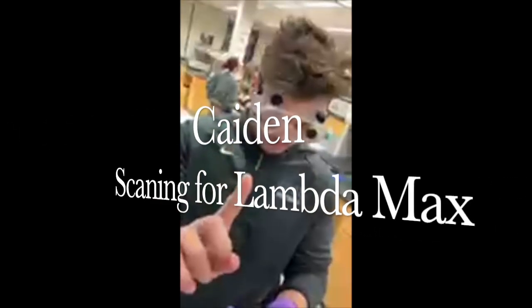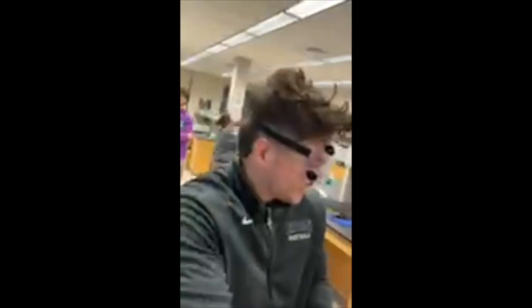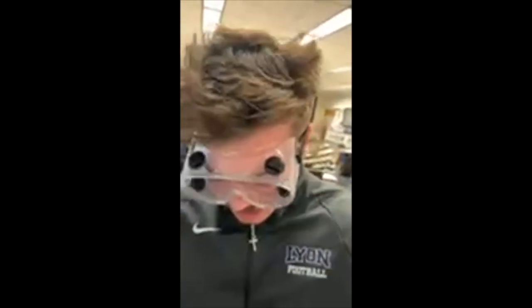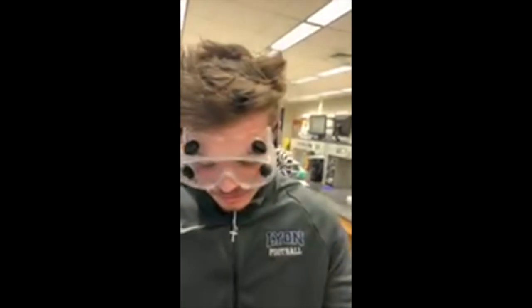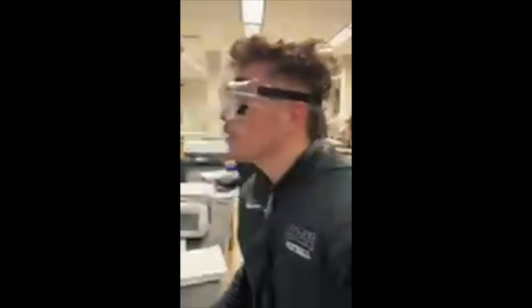Here the graph shows our lambda max is sitting around 640. While Caden regroups, now is a great time to mention, as you will see next, we record the absorbance values in our notebook, ensuring all samples are labeled and significant figures are correct. Lastly, cleanup. After recording data, we carefully remove the cuvettes, as you've seen, and clean our workspace. And now, back to Caden.